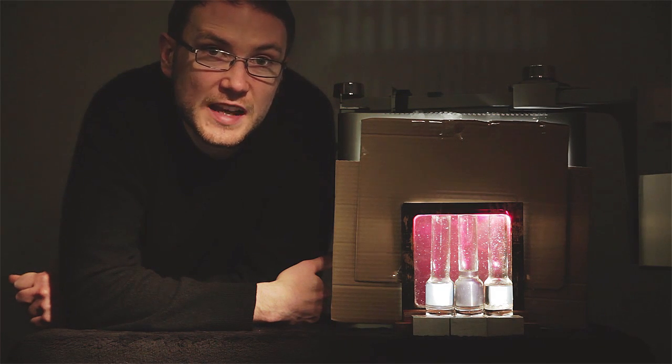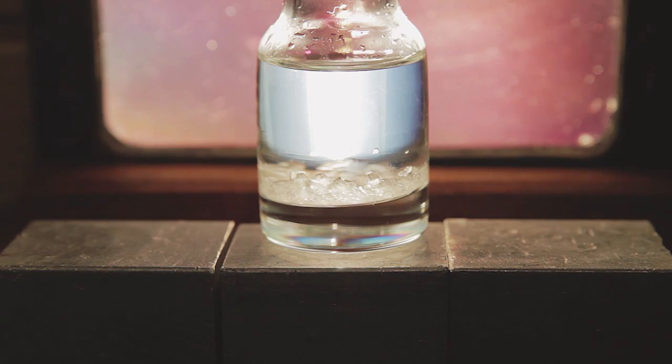The reaction in industry is actually followed by polarimetry. I've had these flasks for a few weeks, so they'll keep long enough for a whole year group to see. You can however see that the sucrose has begun to crystallize, whereas the fructose and the partially hydrolyzed sucrose have not.